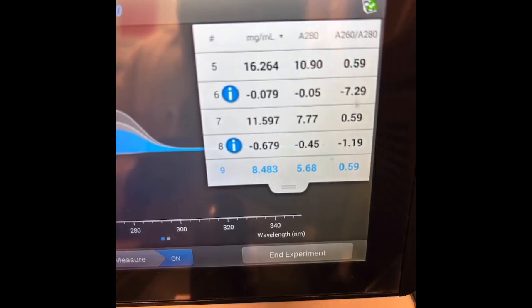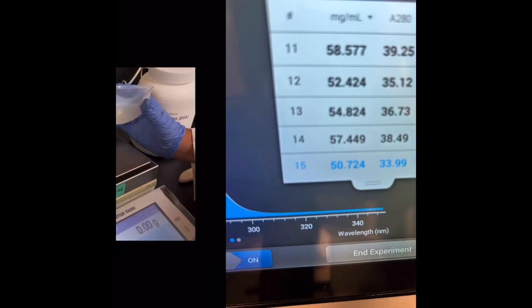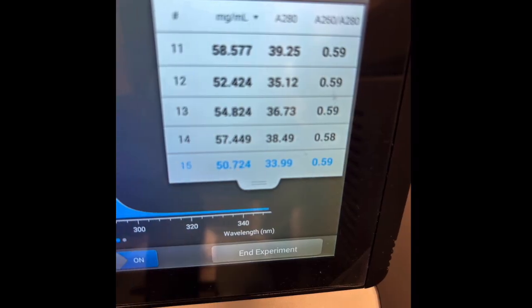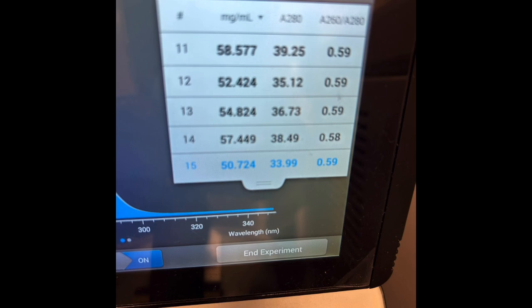Next is the 1 to 2 dilutions, where I added 5 microliters of DI water and 5 microliters of the BSA. As you can see, the Opentrons makes less of an error, but still an error. Number 10 was just a human error. I added it to the nanodrop wrong, so that was the first sample of the Opentrons, but most of the other ones were in the 50s, either the low 50s to the high 50s. And the one I did by hand, my human sample, was number 15. It was 51. And as you can see, this Opentrons sample, number 12, was 52.